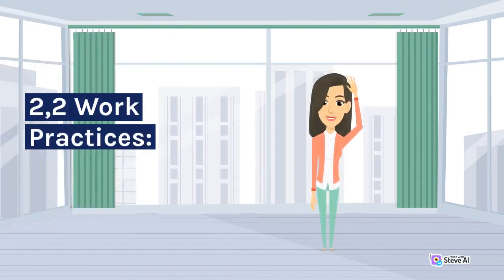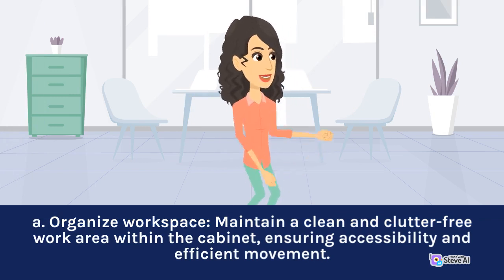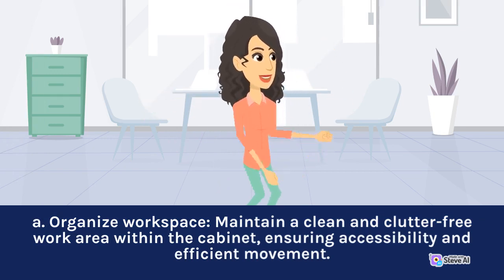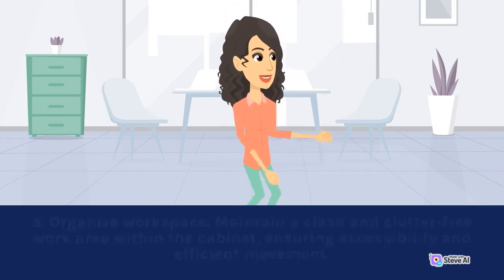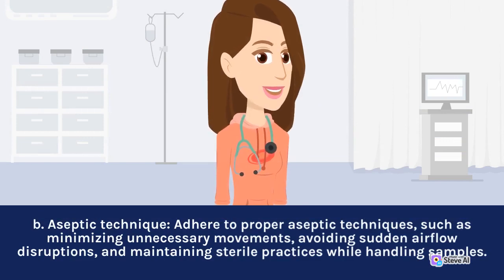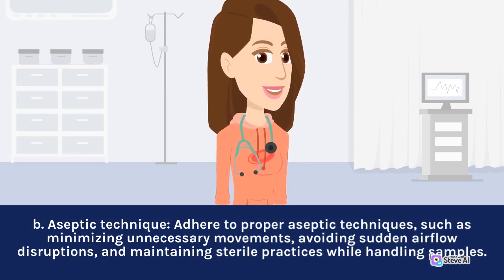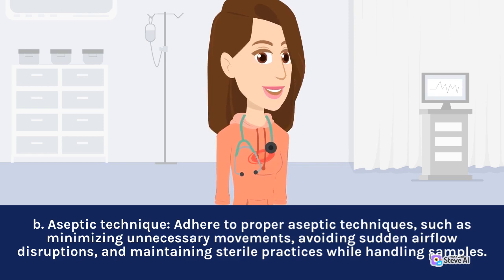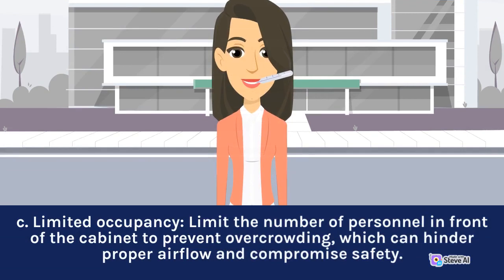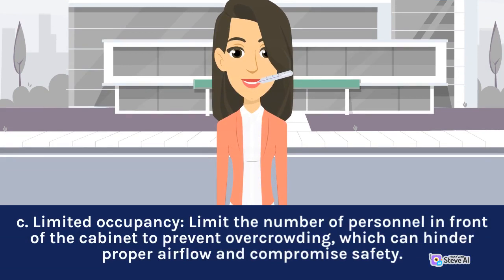Work Practices. A. Organize Workspace: Maintain a clean and clutter-free work area within the cabinet, ensuring accessibility and efficient movement. B. Aseptic Technique: Adhere to proper aseptic techniques, such as minimizing unnecessary movements, avoiding sudden airflow disruptions, and maintaining sterile practices while handling samples. C. Limited Occupancy: Limit the number of personnel in front of the cabinet to prevent overcrowding, which can hinder proper airflow and compromise safety.